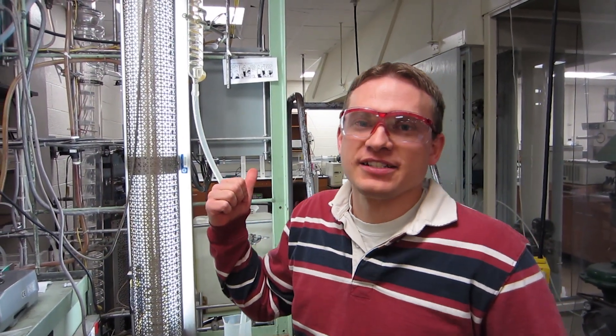This is the batch distillation column. We're separating methanol and ethanol. One of the things we want to find here is the reflux ratio of the batch distillation column.